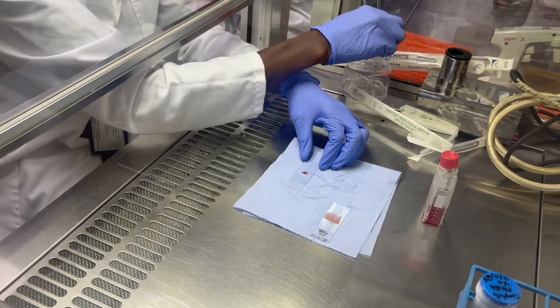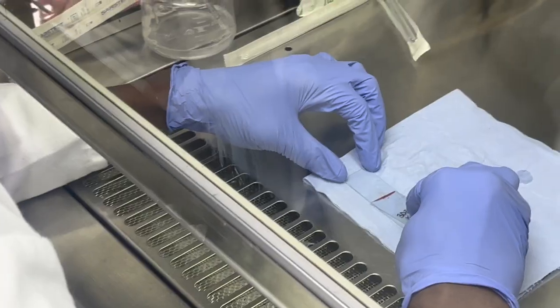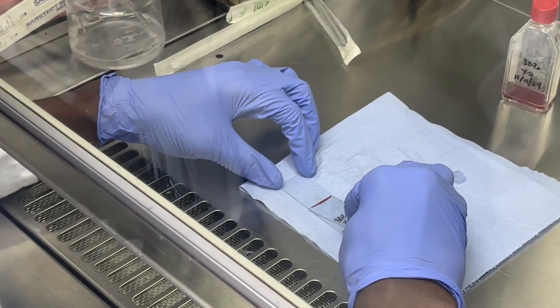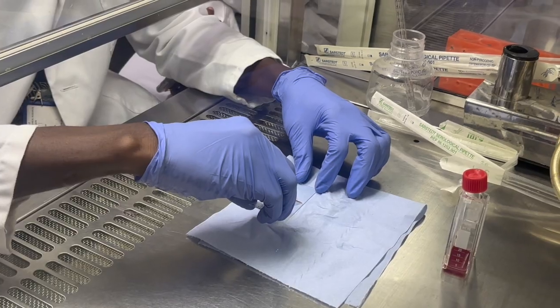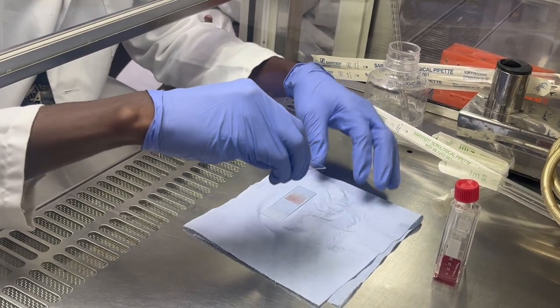Use a clean slide — all slides are cleaned with 90% ethanol beforehand. Use another clean slide to bring the pool of blood into one line, then swiftly drag to make a smear. The smear should be in what is described as a tongue shape.